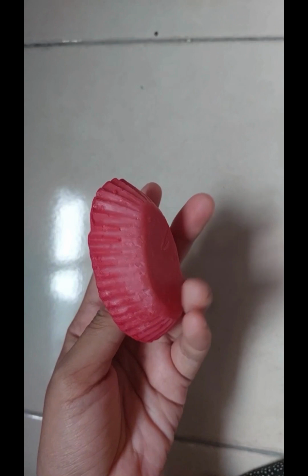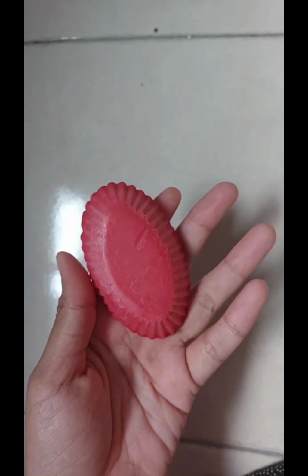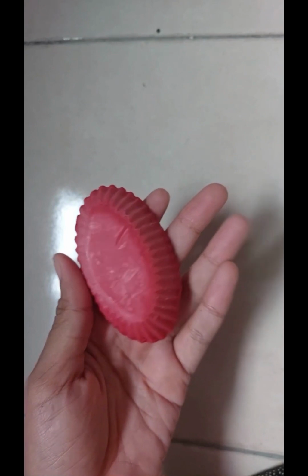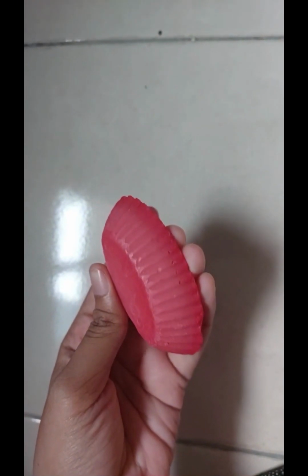This process can contribute to the reduction of pollution and promote cleaner and more sustainable practices in the community. Finally, the soap produced is using NaOH, so the soap can be used only after a month due to the high alkali content.